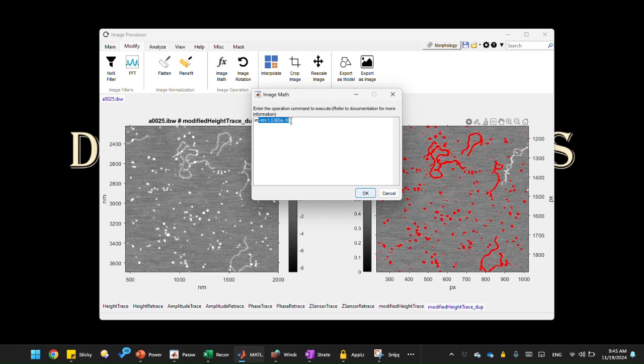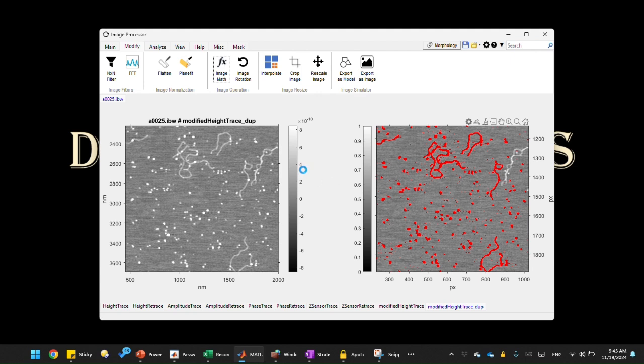And we're going to use this logical image as our mask image. So when we click OK, it's going to create the mask image for us. Right, so now you get this binary image with 0 and 1. The DNA and the proteins are marked as 1, and the background surface is 0. That's the binary image we just created.